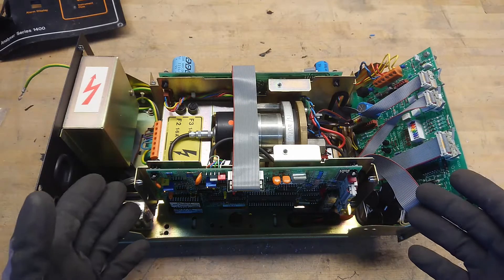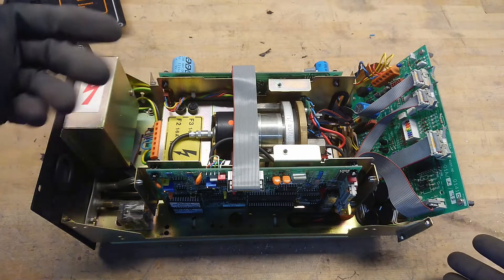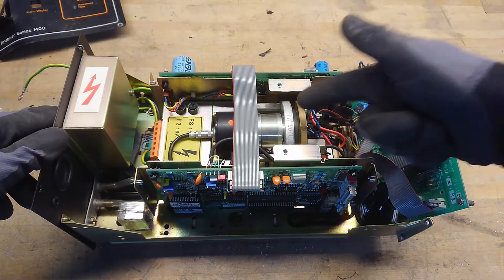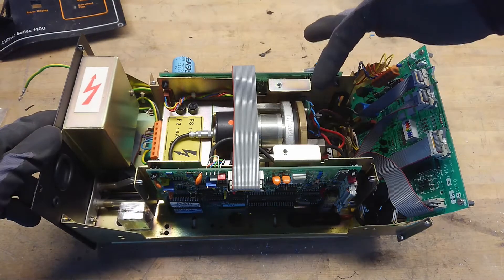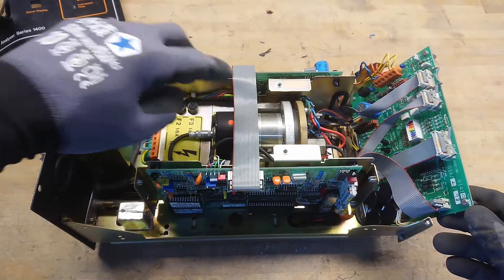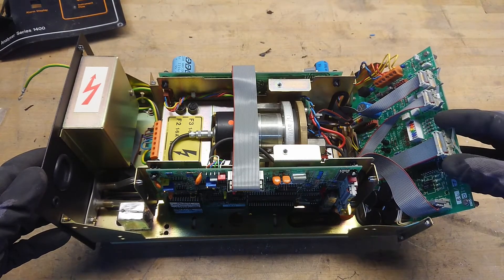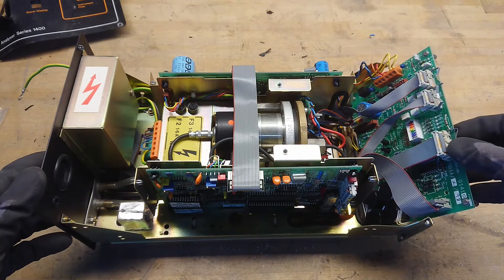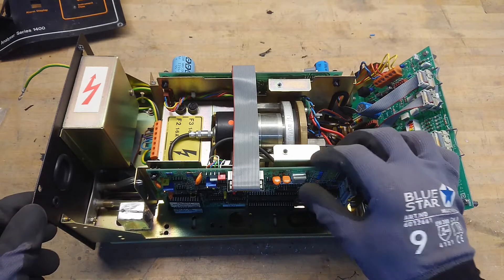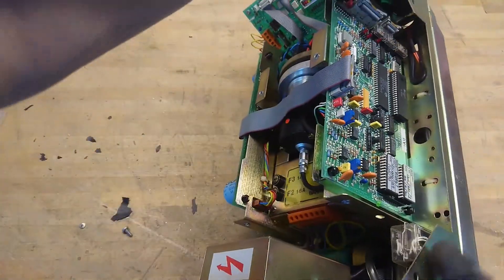Whoa, genuinely surprised — look at that, that's way more awesome than I had imagined. Look at that CO2 pump with some kind of analog sensor sitting here, that has to be some kind of pump and heating element over in this large brass bracket. Seems to be some kind of insulating material or magnet between it and just the boards. Look at the quality of this — small holders on the flat band cable connectors. I love the colored selector switch here. Even have some internal switches and seems to have some ceramic IC packages as well.